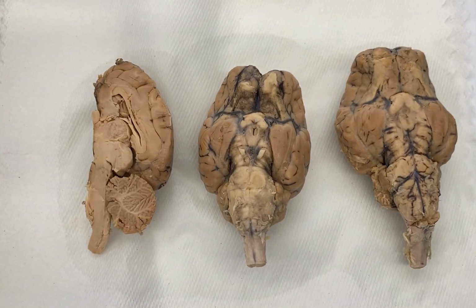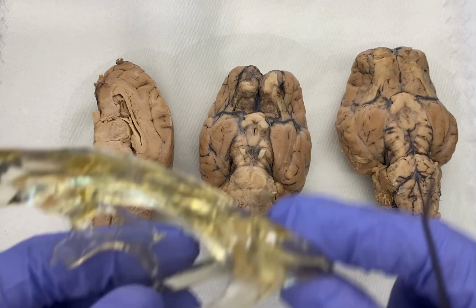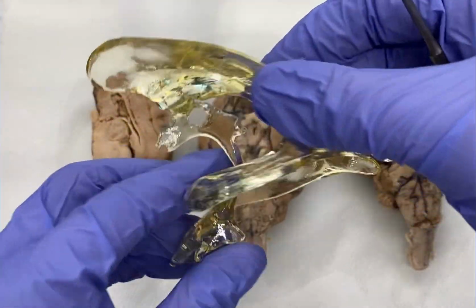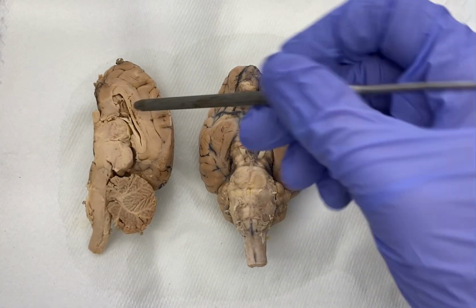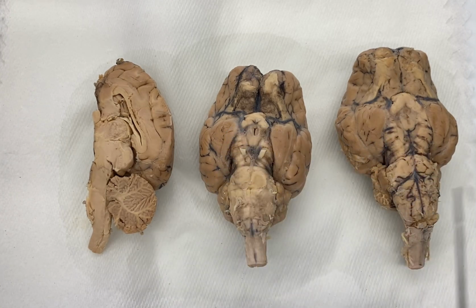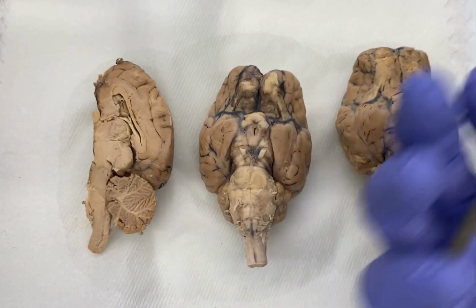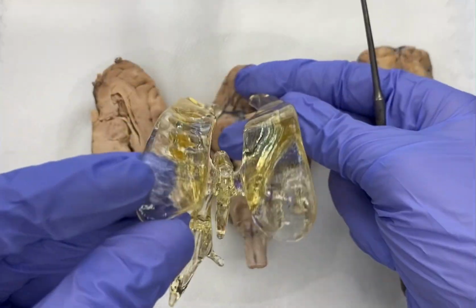So it may be hard to conceptualize and imagine these ventricles, but if I show you a model of the ventricles, it may make a little bit more sense. So this is a cast, a model of our ventricles, okay? It looks abstract, it looks interesting at first, but imagine for a second you have your ventricles all here. Imagine you injected or inserted some type of foam or some other material into these ventricles, and then it hardened, and then you could peel it out. So like you're making a mold of something. That's essentially what this is.